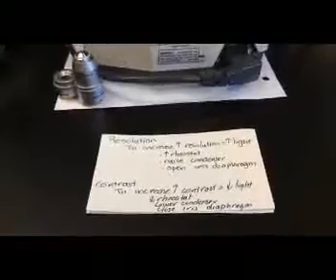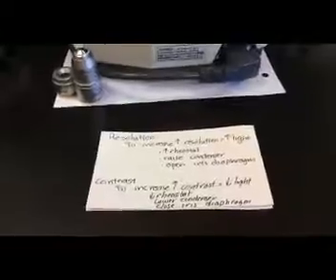Before continuing, I just wanted to go over a couple of concepts that will be important for us to understand the functions of some parts of the microscope. So the first concept that we'd mentioned before is resolution. My gut feeling for resolution is it's the clarity by which we can identify objects. And maybe the best way is to show a simple example here using our index card.